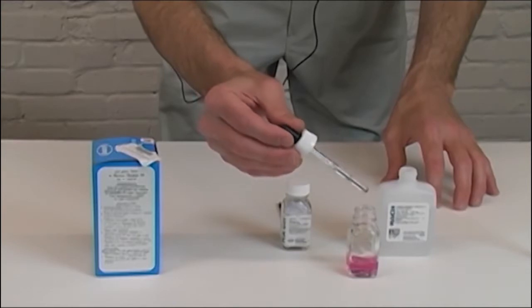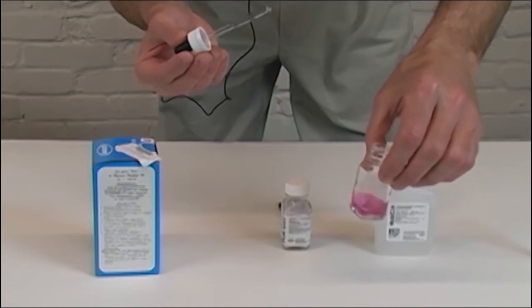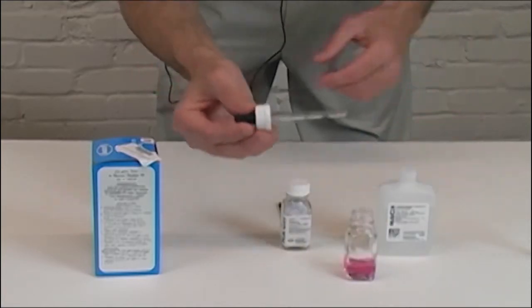So we're going to do one drop and stir it up because you're looking for the color change to turn to blue.